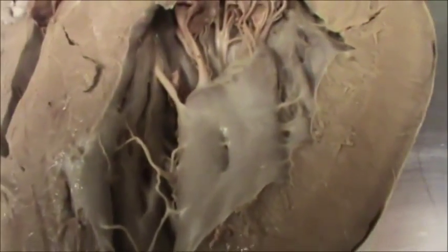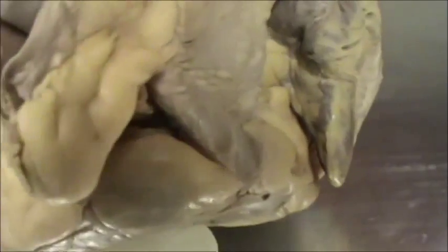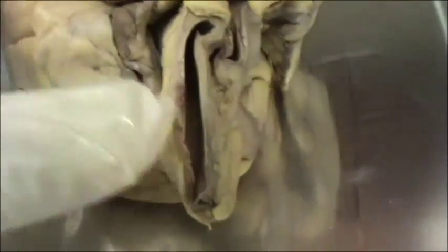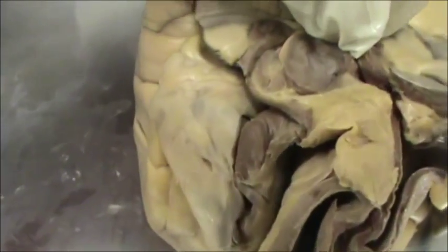Now we can look into the blood vessels — we can see them clearly from the base of the heart towards the posterior side. The thick large opening is the aorta, and we can also identify the pulmonary trunk and superior vena cava.